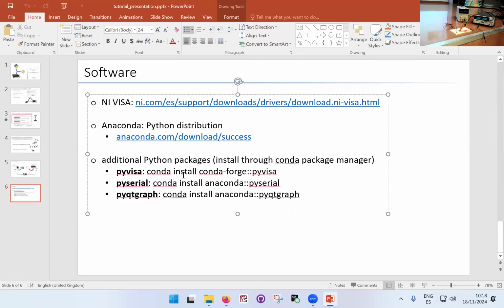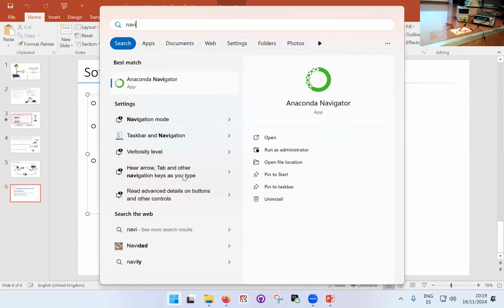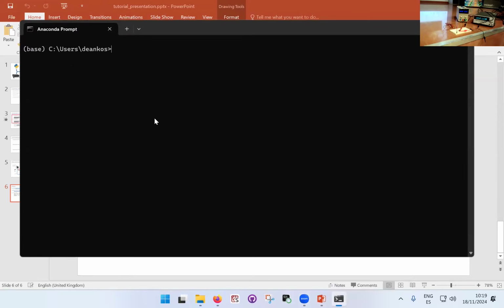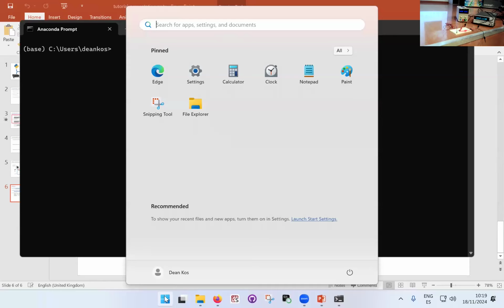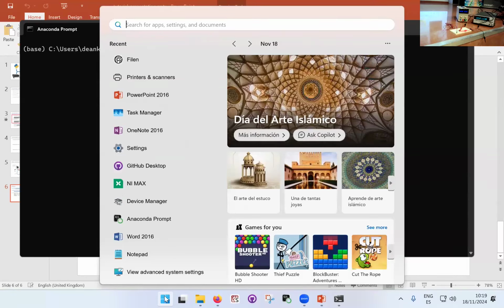If you install Anaconda the usual way, it has a feature called Anaconda Navigator. You can open it and it will have a fancy interface to install packages. But I found that not all packages come up in this fancy interface, I don't know for what reason. So I generally don't do that, but rather I run a command line. This is the so-called Anaconda Prompt, and it looks very much like the Windows command prompt, but it runs through Anaconda. So it will understand the Python commands and the Anaconda commands. You can find it here on the taskbar. Once you install Anaconda, it will come up in your search list as the Anaconda Prompt. You might need admin permissions to do that, so just keep that in mind.